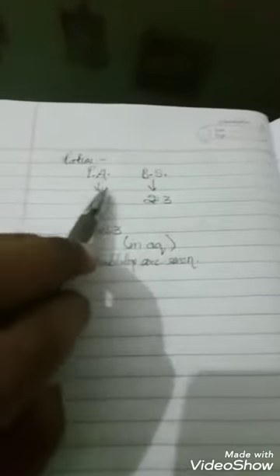PA stands for potassium alum, which is potassium aluminum sulfate, and baking soda is noted by BS. The ratio of both of these should be 2:3. This is because if you're using it in aqueous solution, most of the baking soda is going to dissolve and create the perfect ratio.